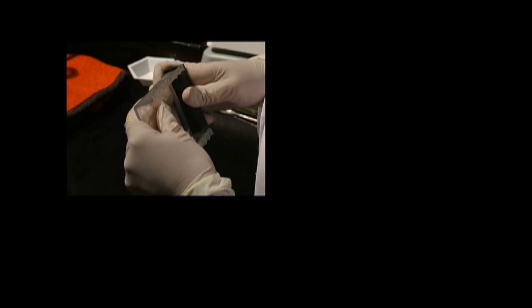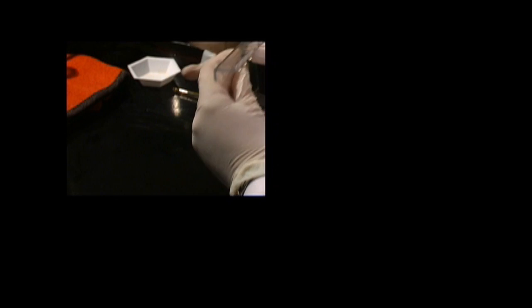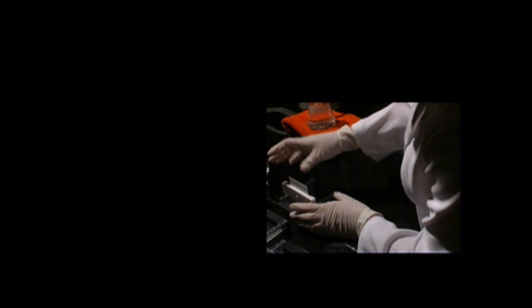To prepare the gel bed, first close off the open ends using rubber dams. Make sure that the bed is clean and dry. Place a well-former template, known as a comb, in the first set of notches nearest the end of the gel bed.